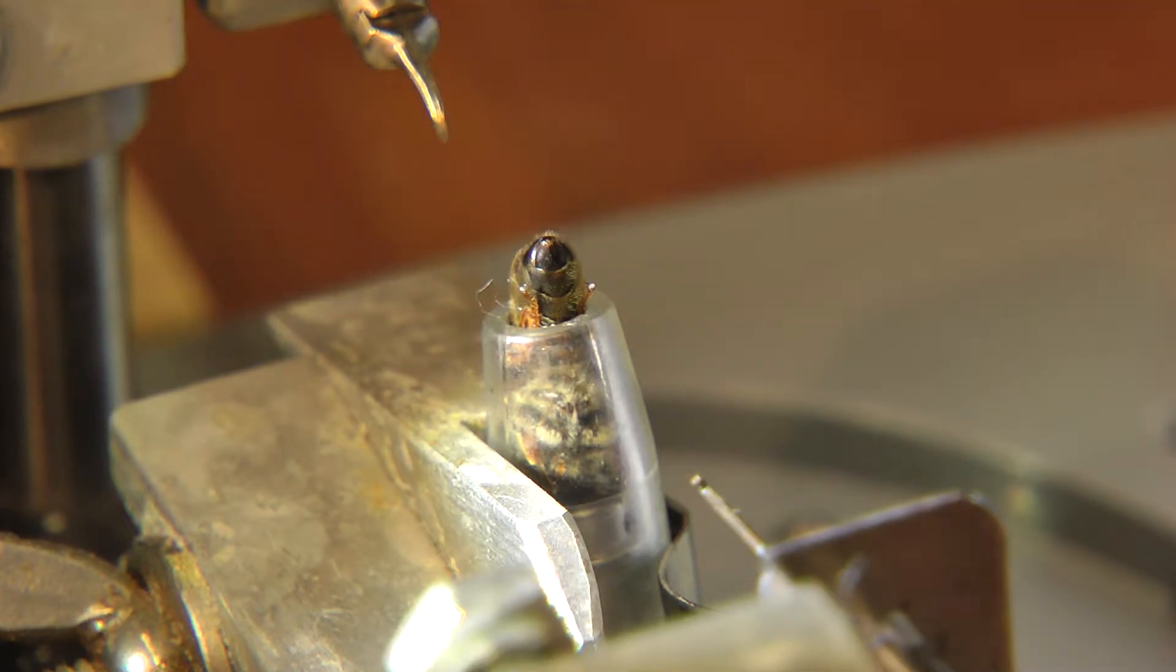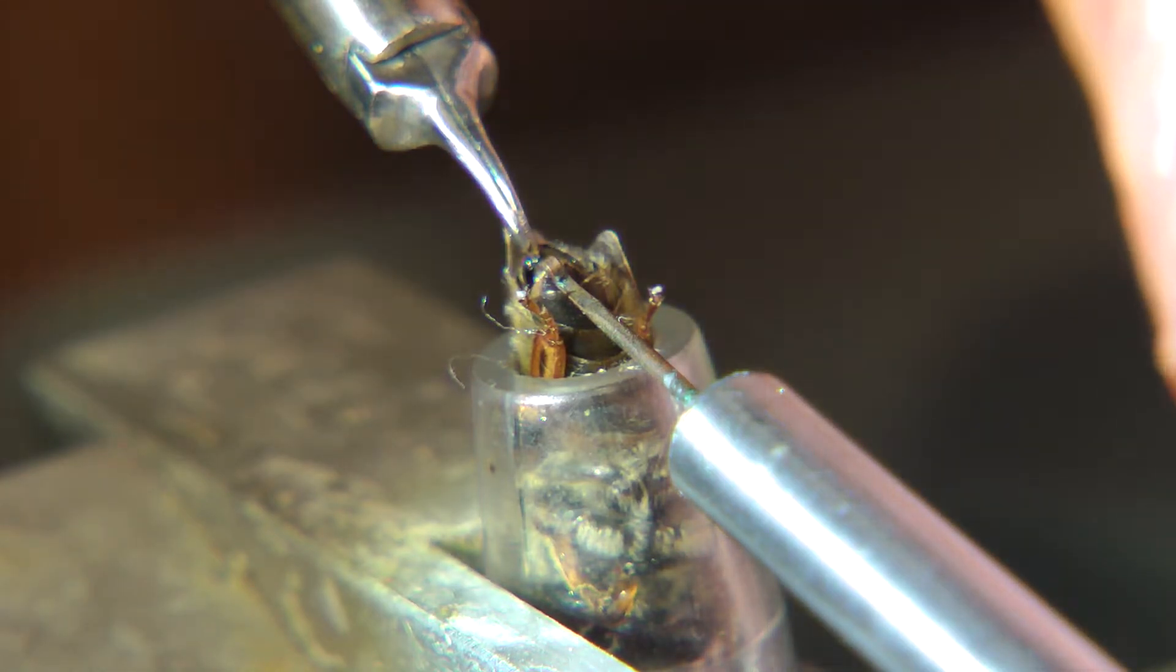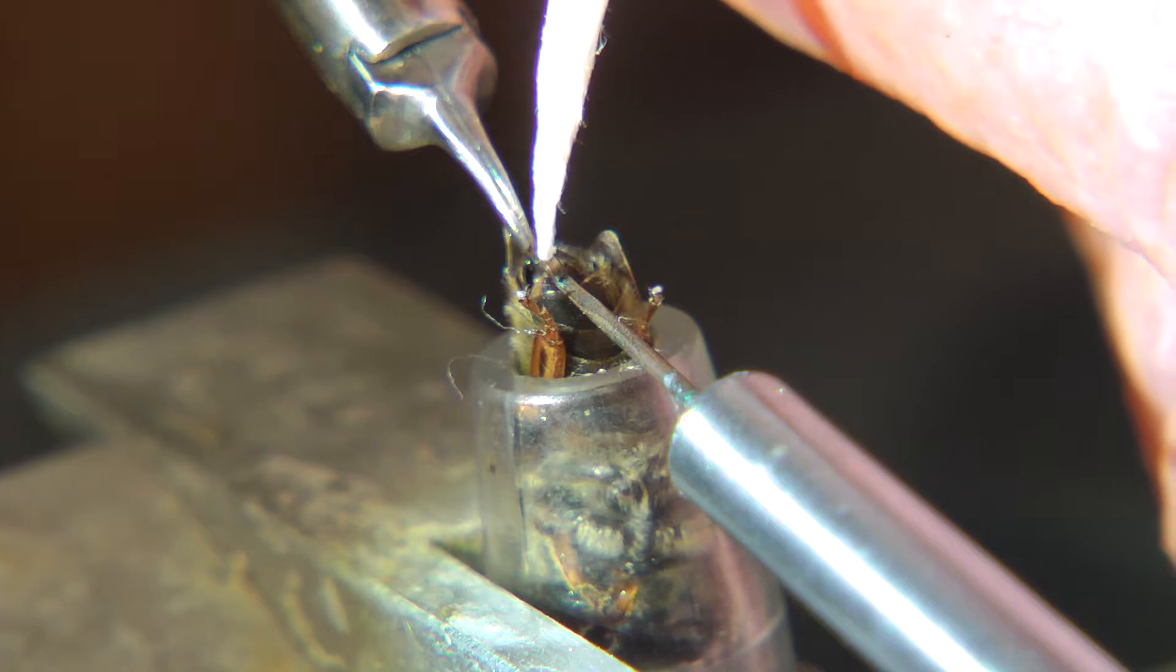Carbon dioxide is flowing up the tube and around the queen, with her abdomen sticking out. Bill cleans out some poop with a piece of tissue.